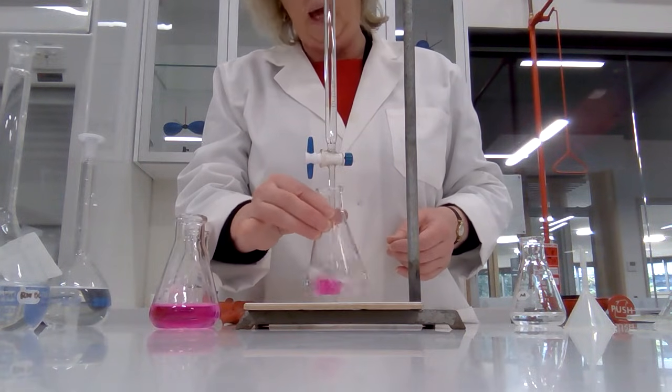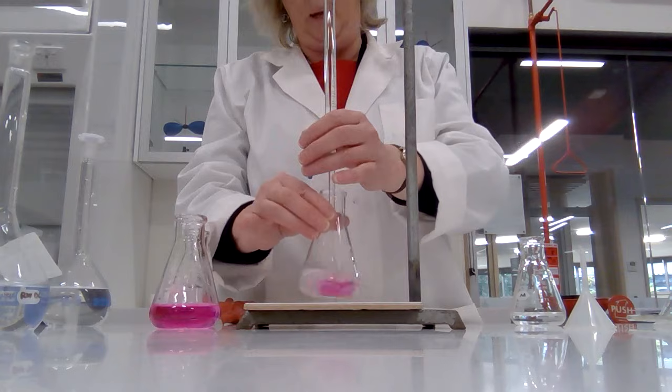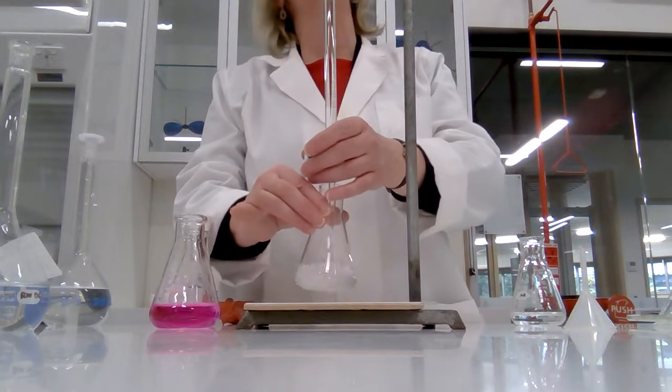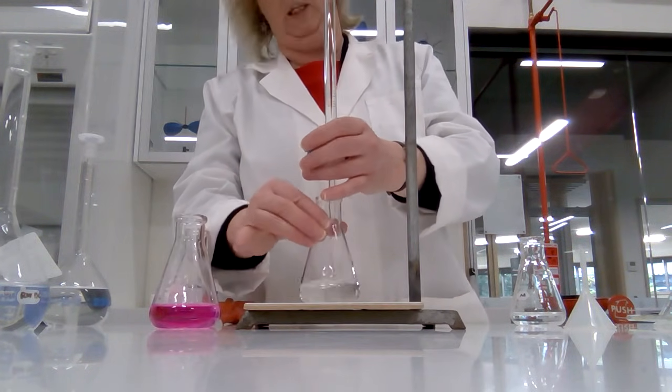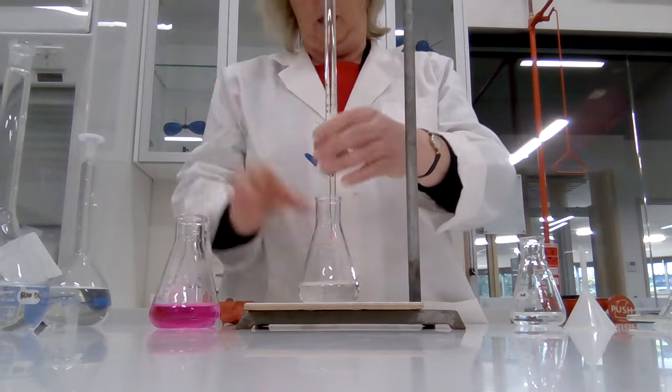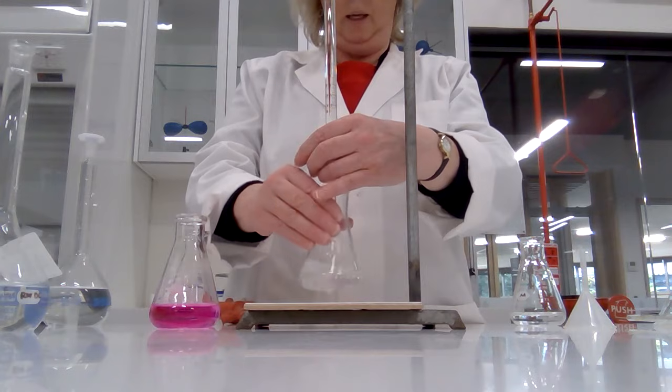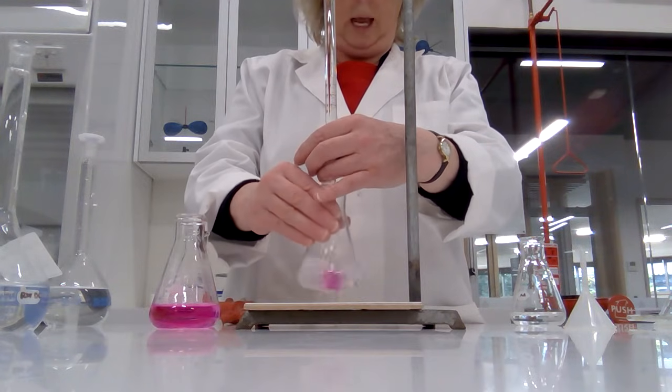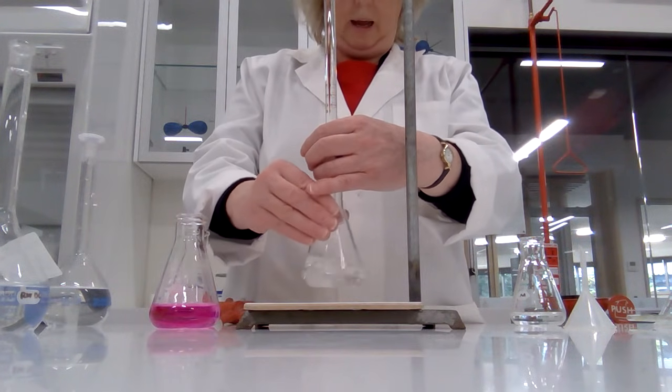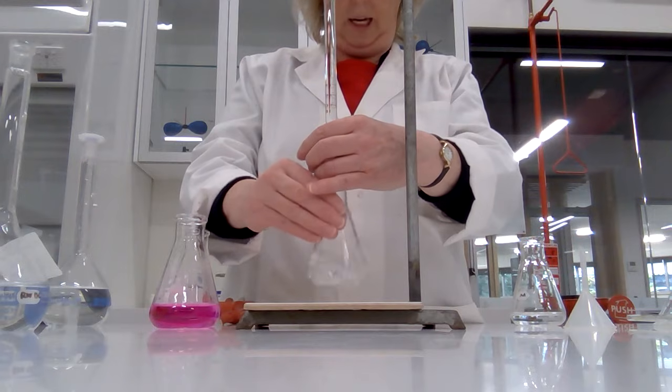We just keep adding. You can see the pink color is there but it disappears. I've been rather cavalier with this but that's okay. There we go, we just keep adding. I'm watching the pink but it's disappearing. It appears and it goes away. Keep adding and it vanishes.